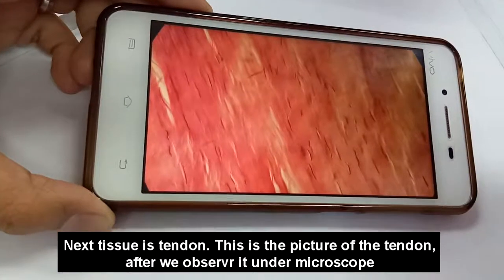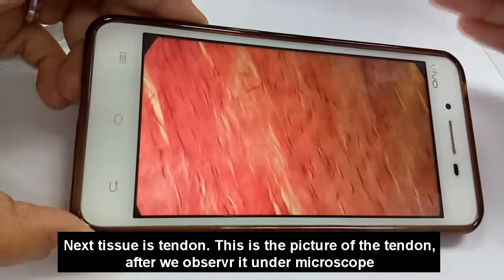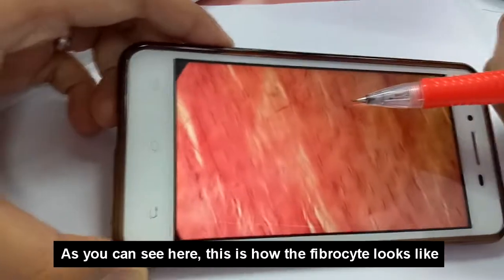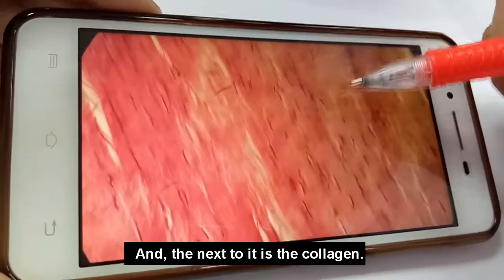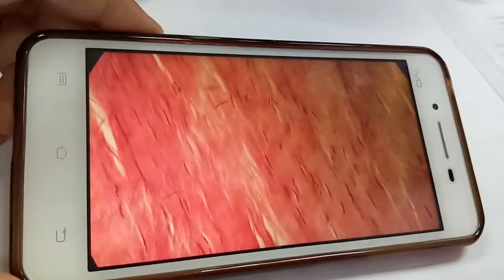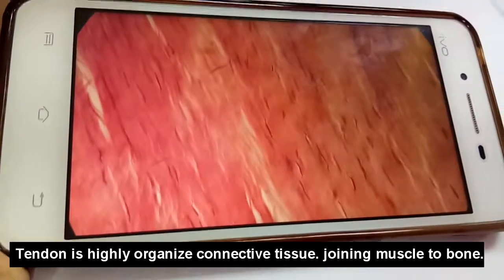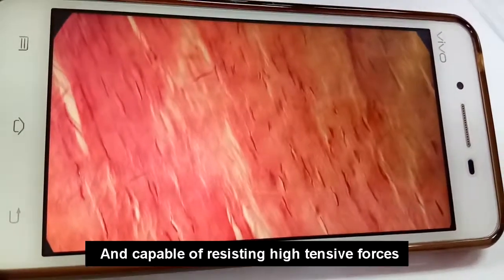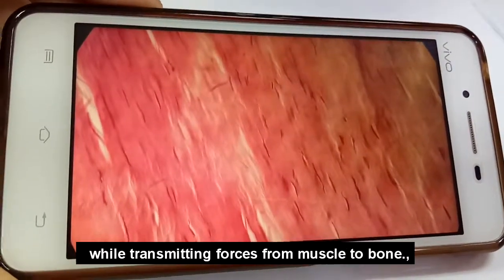Okay, the next tissue is tendon. So this is the picture of tendon after we observe it under the microscope. As you can see here, this is the fibrocyte nuclei, and next to it is the collagen. All of this is the collagen. Tendon is a highly organized connective tissue joining muscle to bone and capable of resisting high tensile forces while transmitting forces from muscle to bone.